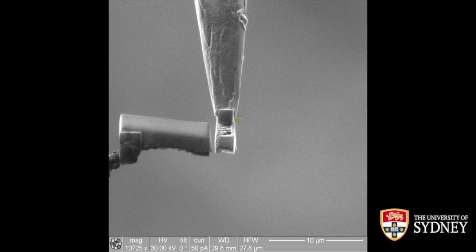Once you're finished with the cutting step, it should look something like this here then. So you can see again there is some voltage contrast between the lift-out bar and the lift-out piece attached to the support structure, which tells us that the cut's gone all the way through and there's no contact anymore, and it's safe to move your stage now.